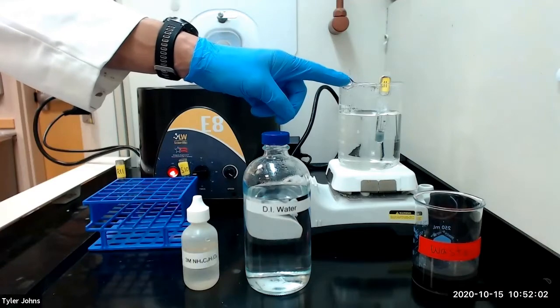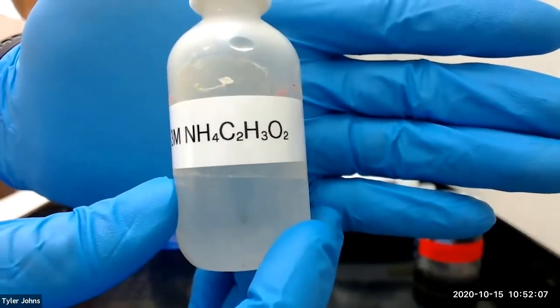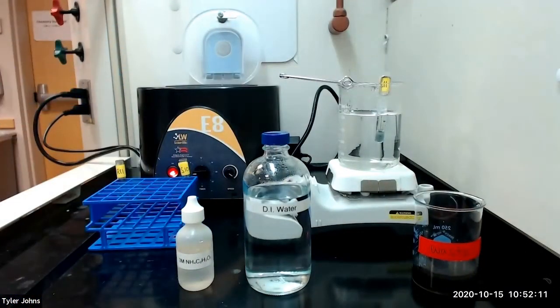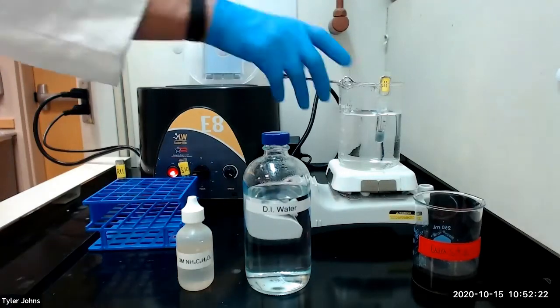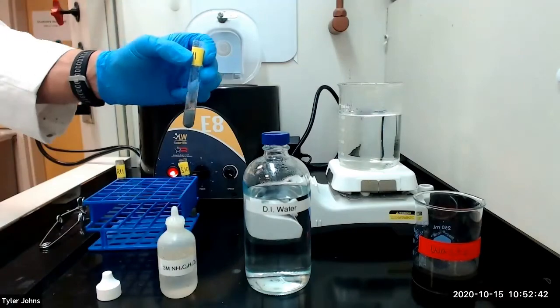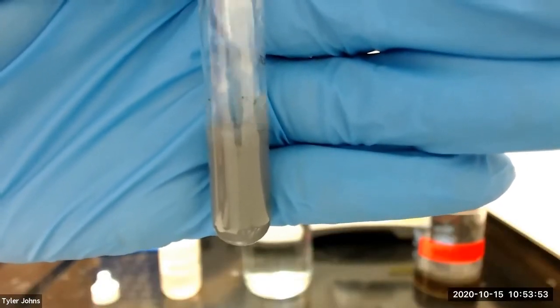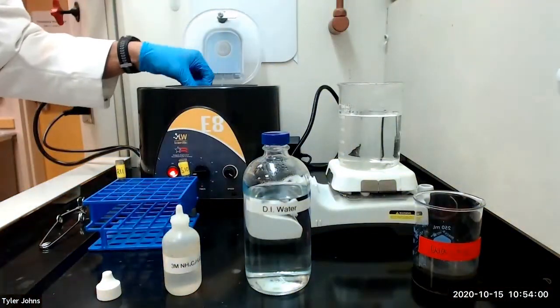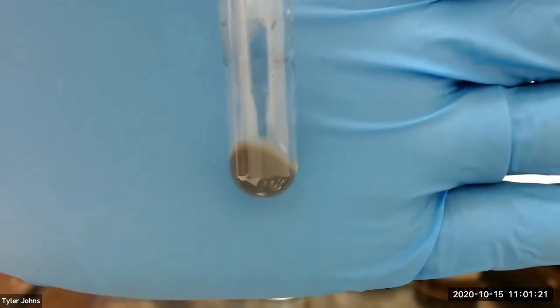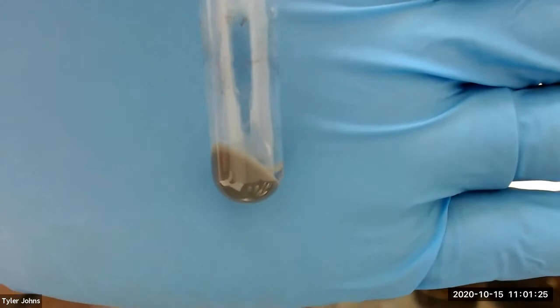After 5 minutes of heating, we will remove solution S11 from the heat and add 10 drops of 3 molar ammonium acetate. We will stir, centrifuge, and discard the wash liquid. This light gray precipitate of zinc sulfide indicates the presence of zinc ion.